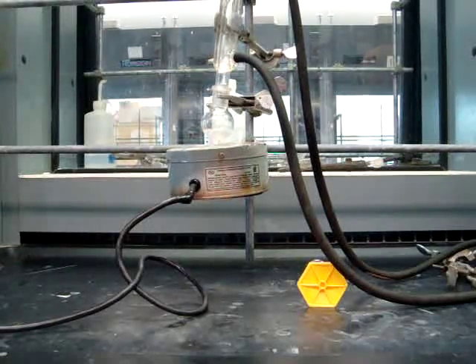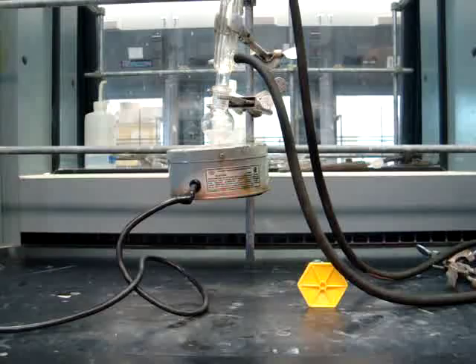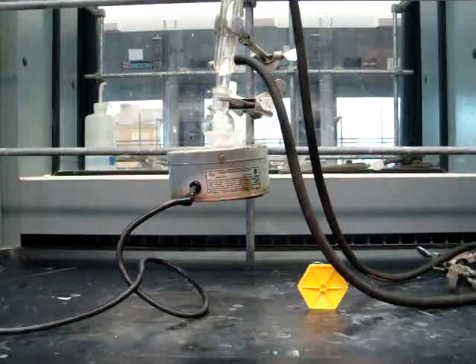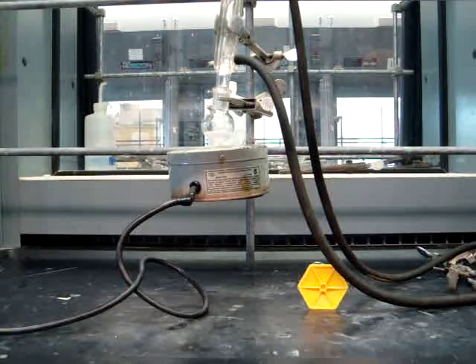As you have seen before, in a 25ml round bottom flask, we've added 1g of camphor. Then you'll add 5ml of methanol to the camphor and agitate to dissolve.